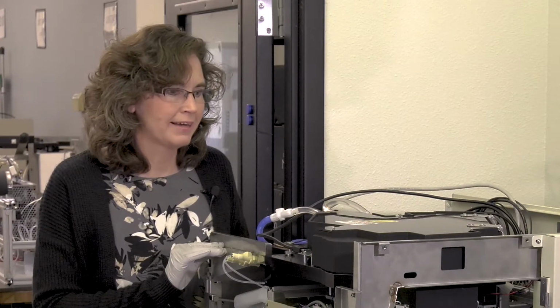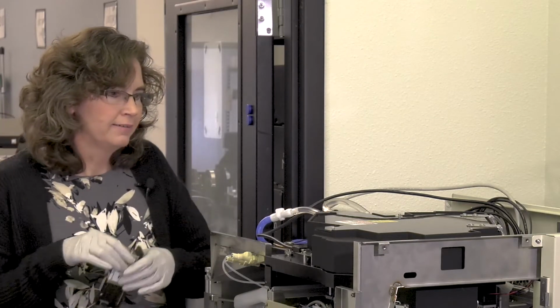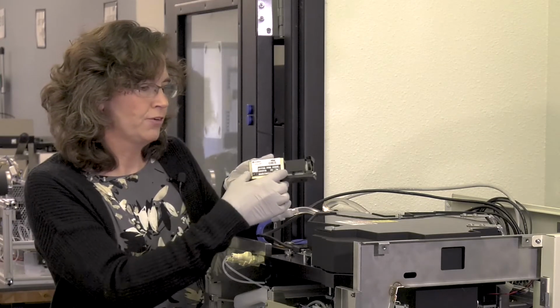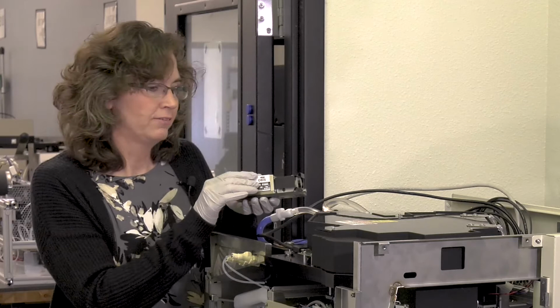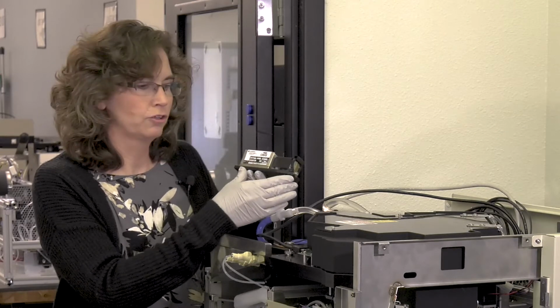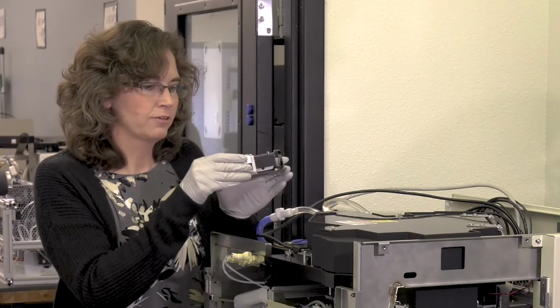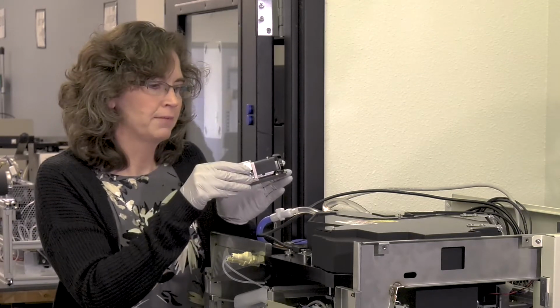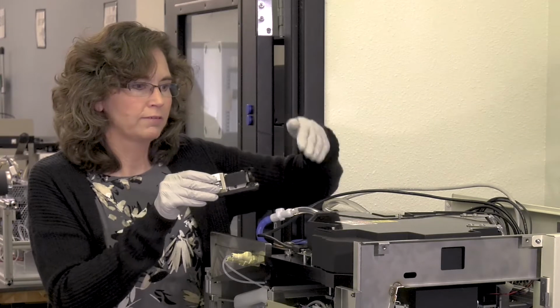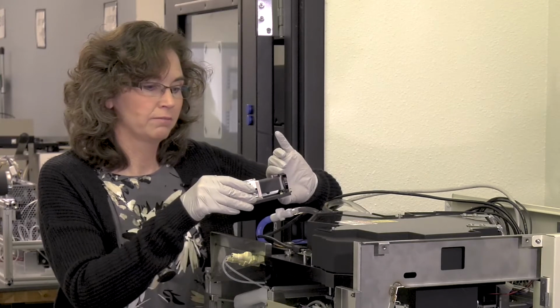The main idea we had was to make everything as small as possible. We were lucky enough to be able to work with Coherent, and they had these very small modules, a very new platform for their lasers. They were also willing to put the lasers onto a particular base plate and set up the rest of the optics for us, so that this entire laser is the system we're working with. From the front of this module to the cells is pretty much just flat optics that are doing a tiny amount of steering, fixed once and then locked in forever.